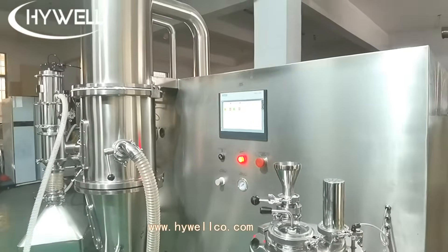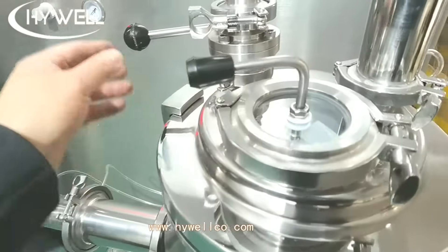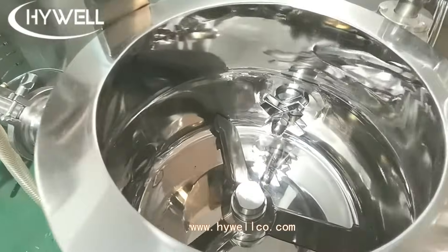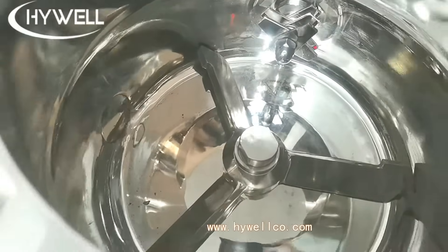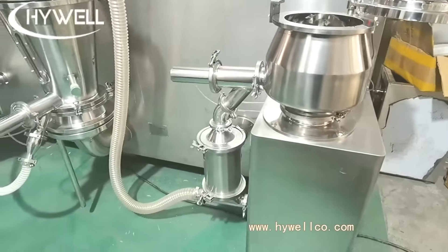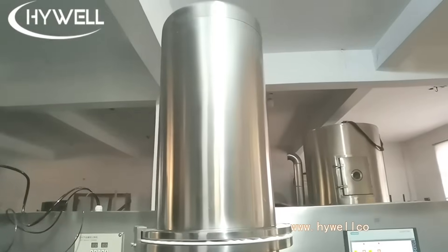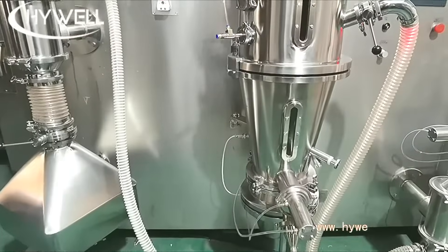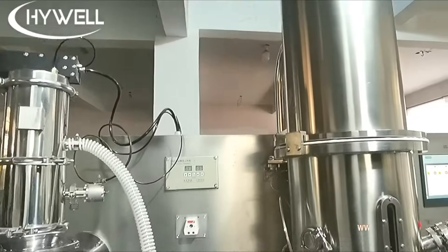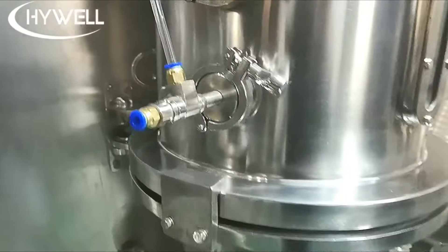One way to achieve this is through closed production systems, which are designed to protect the product and the environment from potential hazards. Closed oral solid dosage production refers to a manufacturing process in which the OSD product is manufactured in a closed system isolated from the external environment. This system includes a series of interconnected self-contained units designed to prevent the release of hazardous materials or contaminants into the environment, minimizing the risk of contamination and ensuring the final product meets required quality standards.